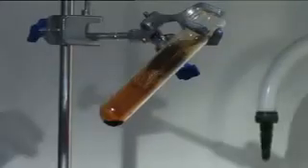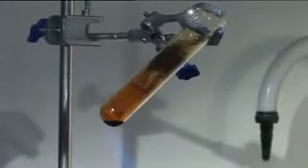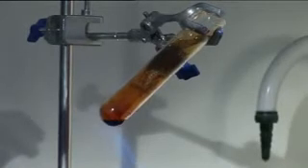This time what we're going to do is use some bromine to react with the iron wool. We've put a few drops of bromine liquid, so I'm just going to warm up the bromine to get it to vaporize and then heat the iron wool.